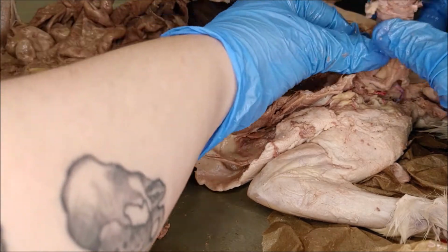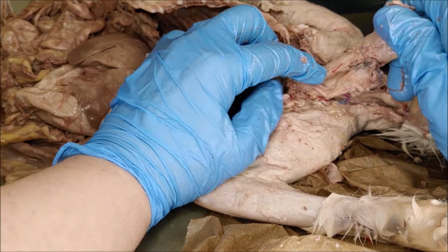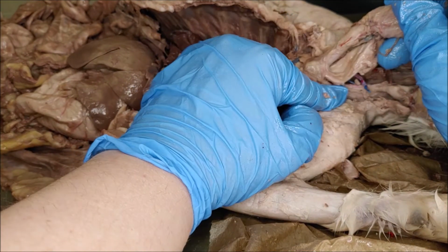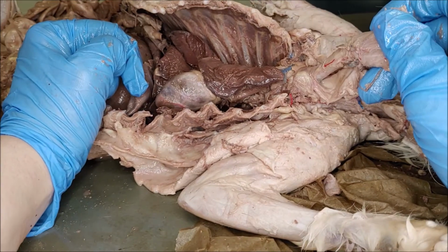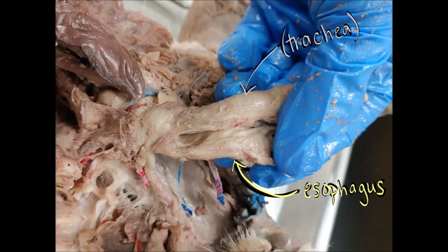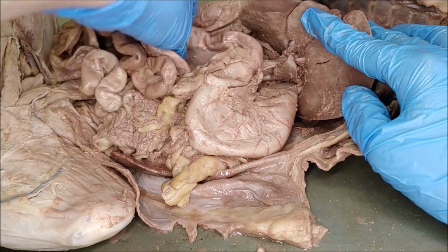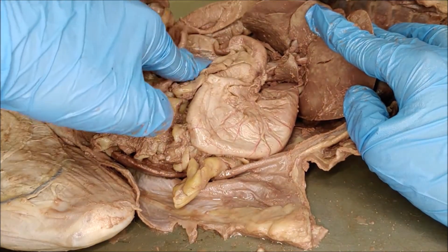So just behind the trachea is the esophagus. Now the trachea had those rings of cartilage to keep it open. The esophagus does not. It is very soft and it doesn't have any cartilaginous rings holding it open. So that's how you'll tell the difference between the trachea and the esophagus. And then when you look down into it, the esophagus is the one that is not covered with the epiglottis.